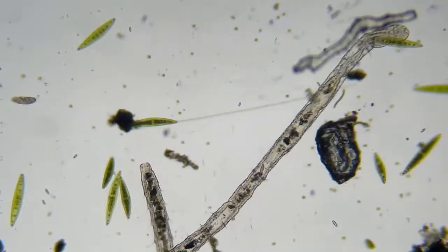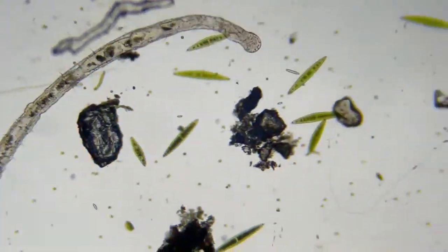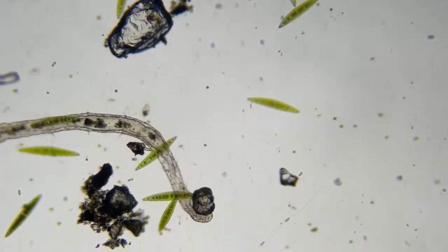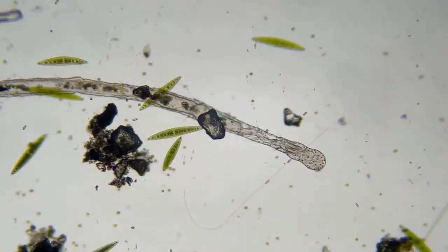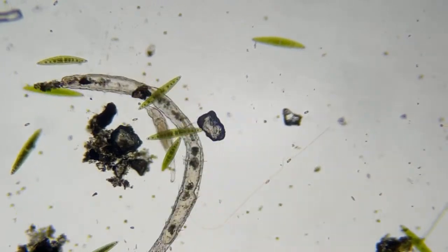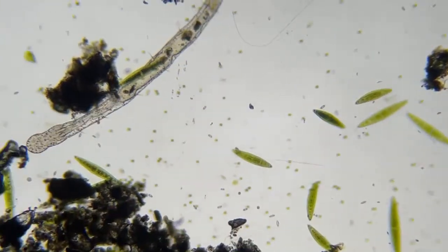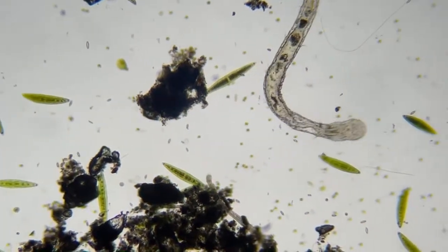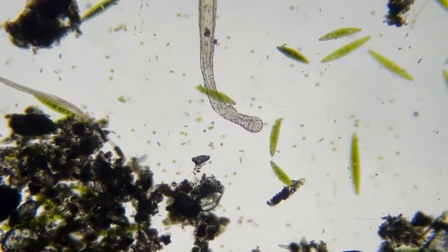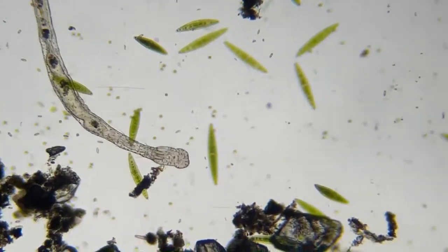It's just not going to happen. Without that 3D stage, my hands would be under there. I'd be moving it back and forth. And when you're looking through the camera like this, through the iPhone, everything's reversed. So you move one way and you think you're going the other way.